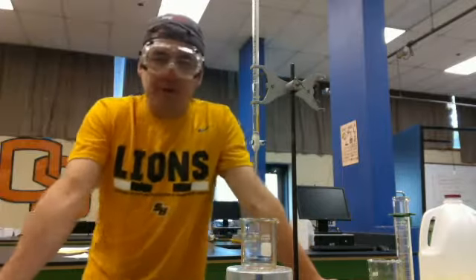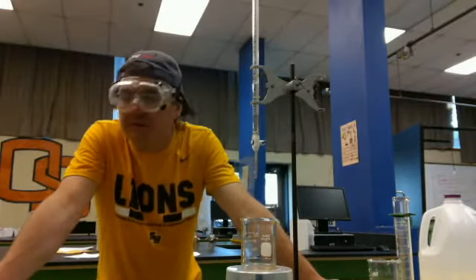All right, chemistry class. I'm going to do a real titration using some chemistry glassware.